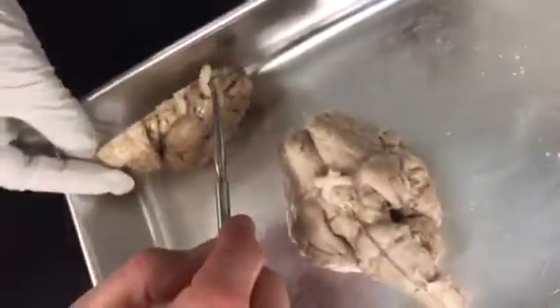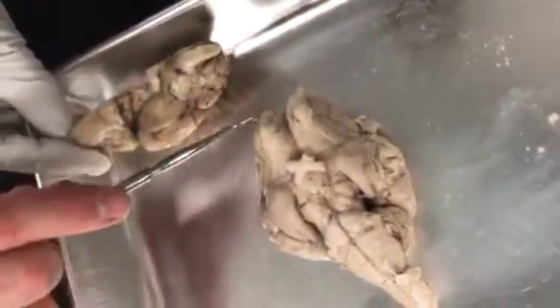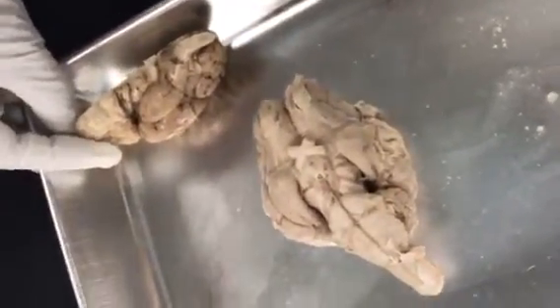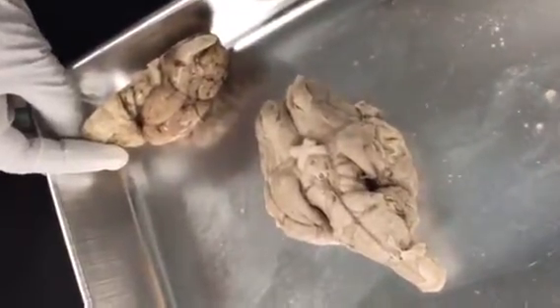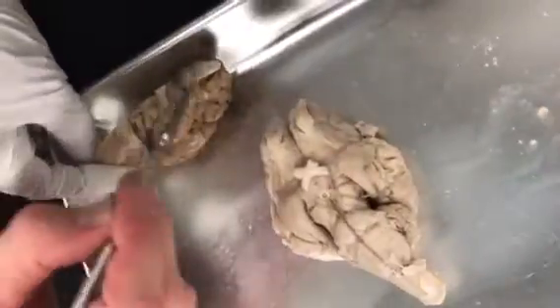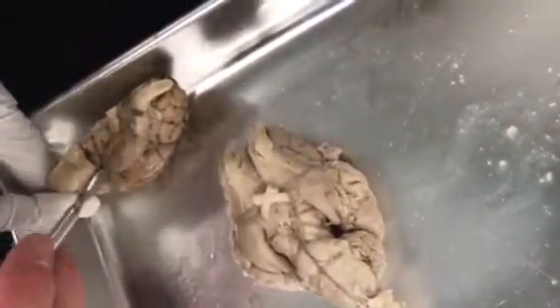Okay. So, see this big thing sticking up there? That is an olfactory bulb. On here, there's two of them. These sit right on top of the ethmoid bone. You remember the ethmoid bone? Crista galli? Or cribriform plate? Little holes? What are those holes called? The olfactory foramina, right? And I told you that the olfactory nerve went through them. It goes from the nasal cavity up through them and into the olfactory bulb. It'll synapse in there, and then the next neuron that comes back forms the olfactory tract.